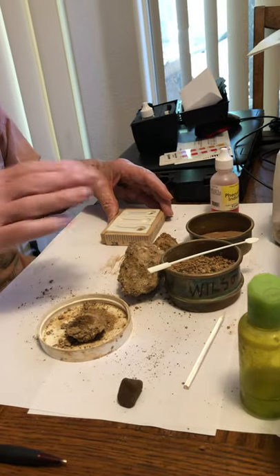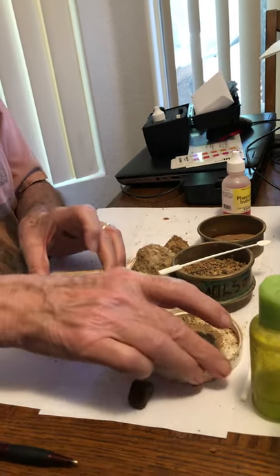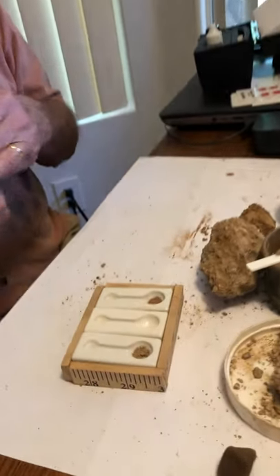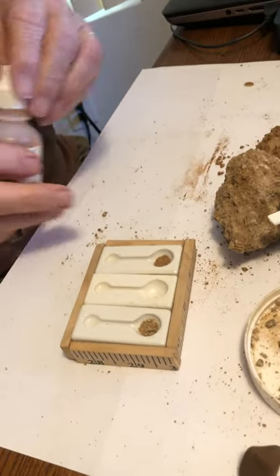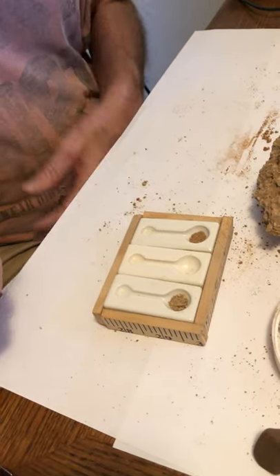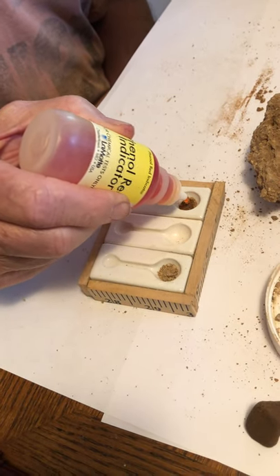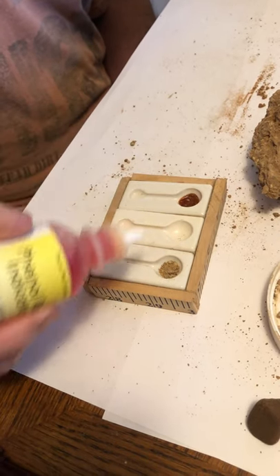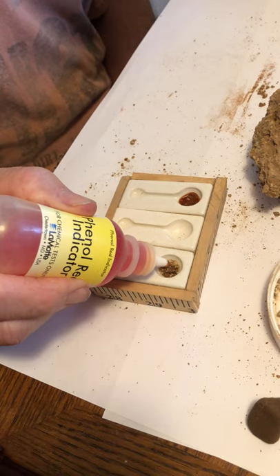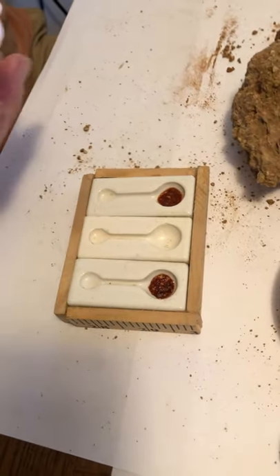All that is is just a quick indicator for you to understand where the pH range may fall. This is the apparatus, and I'm using phenol red as an indicator. This is the A horizon and this is the C horizon — one had a very strong reaction and the other had very little or no reaction.